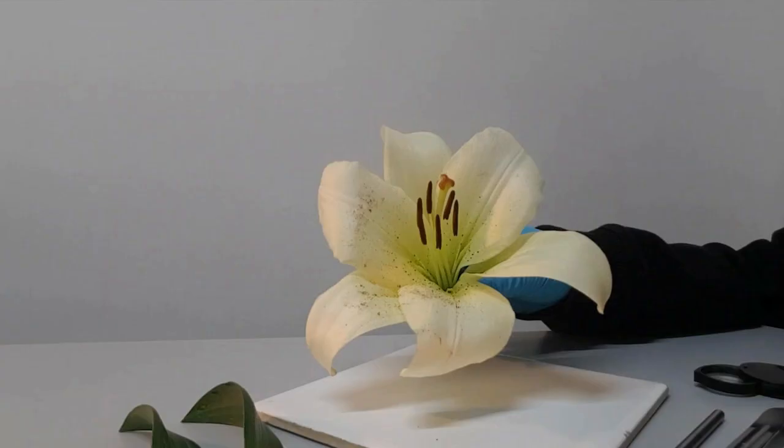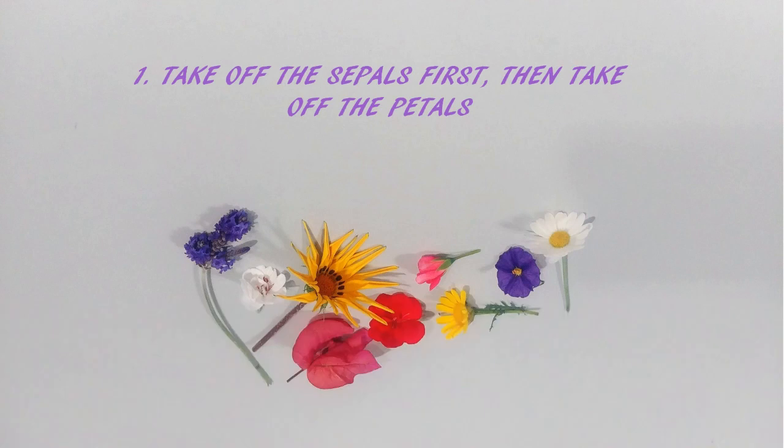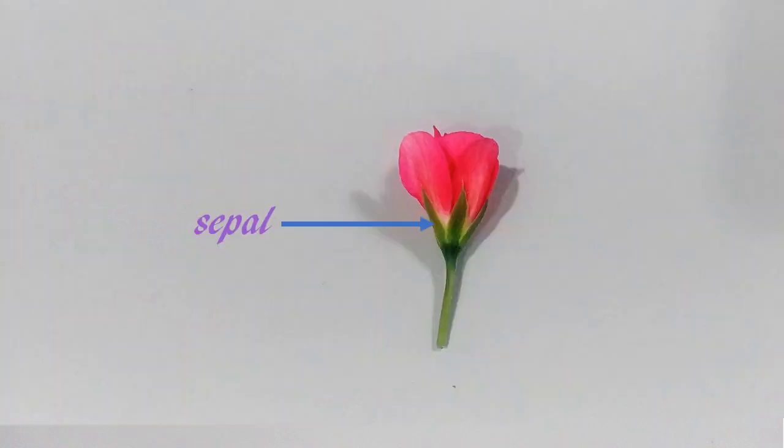In this video, the experimenter used this flower. It's a lily. The first thing you have to do is take off the sepals, then take off the petals. The sepals are these green structures that protect the flower just before it opens.